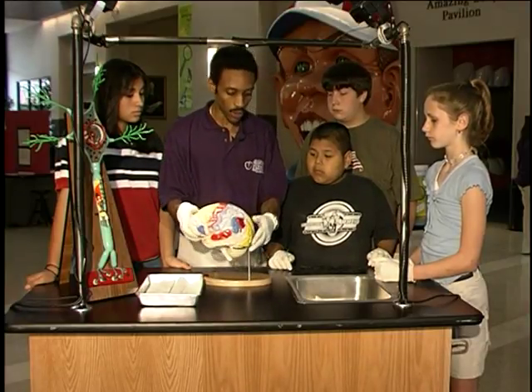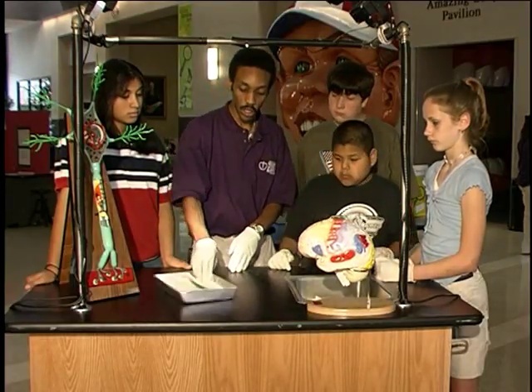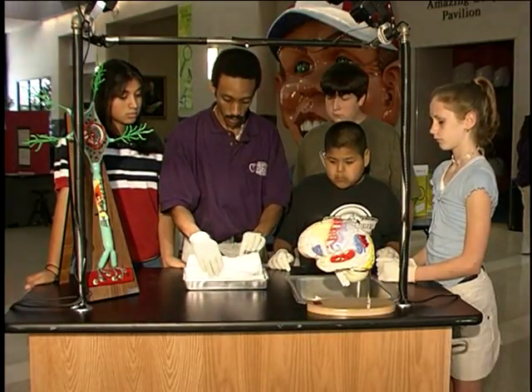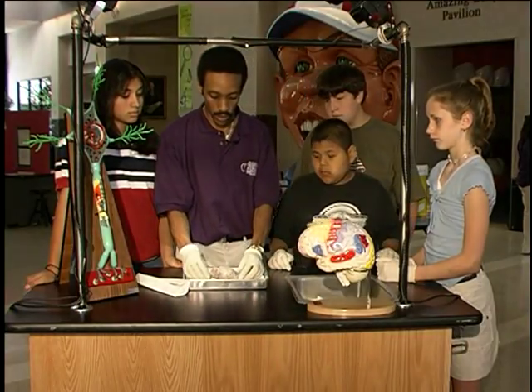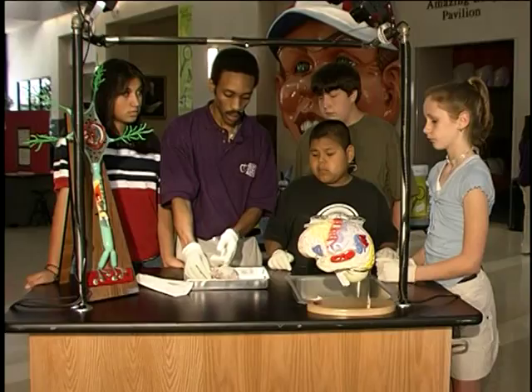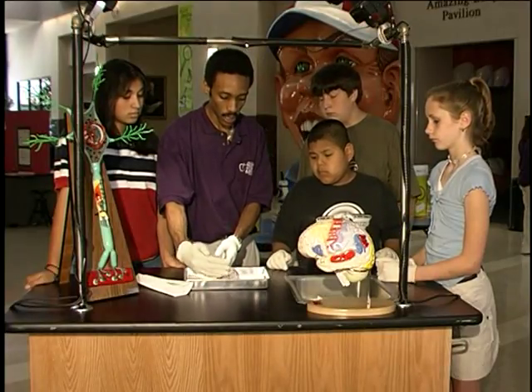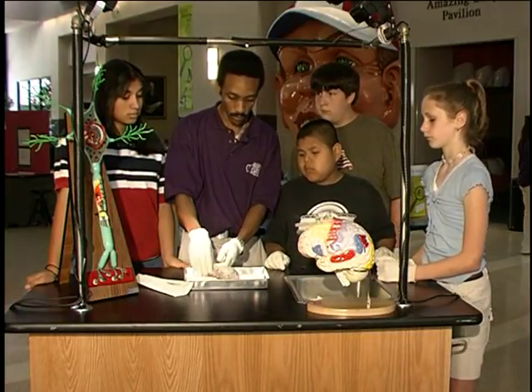Now, with that brief introduction, I think we have enough information to begin to take a look at one of these sheep brains. Here's one of our sheep brains. It is a real sheep's brain. The sheep's forehead would be here. This would be the right side of the sheep's head. This would be the left side, and the sheep's body would be in this direction.